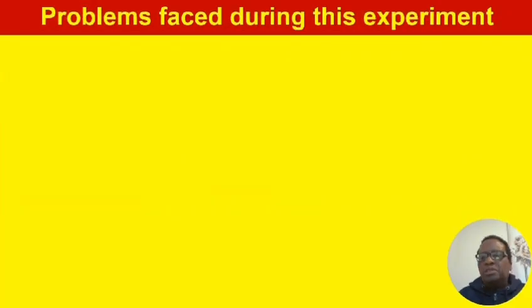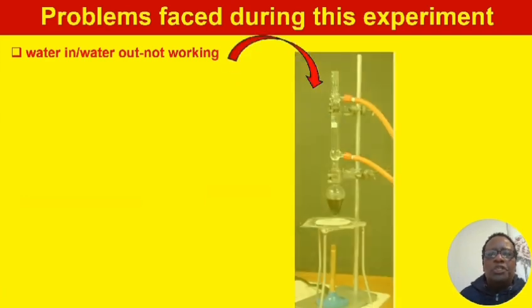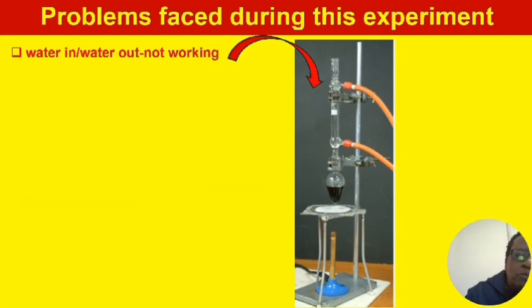The purpose of this video is to help you avoid the mistakes that can happen when you carry out this experiment. Number 1, we did not expect poor water in, water out in the lab. The water in, water out was not working. We opened water from the tap here, but it was not coming out on the other end. The pressure was very low.